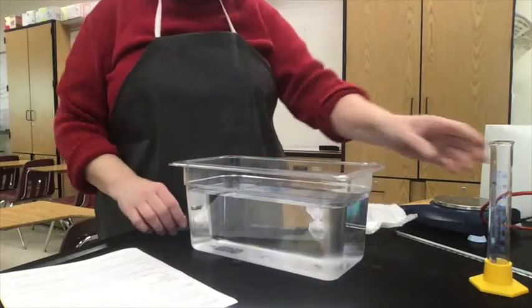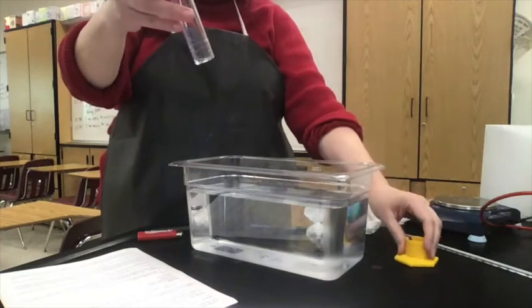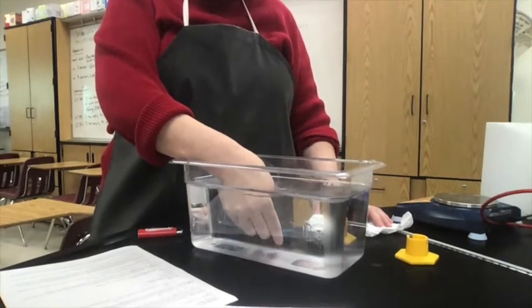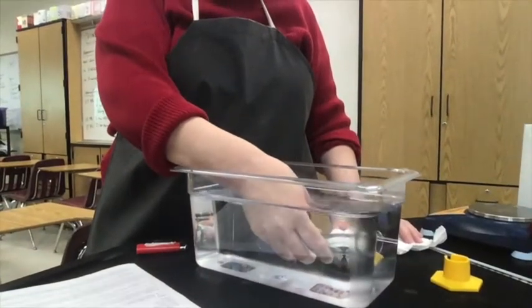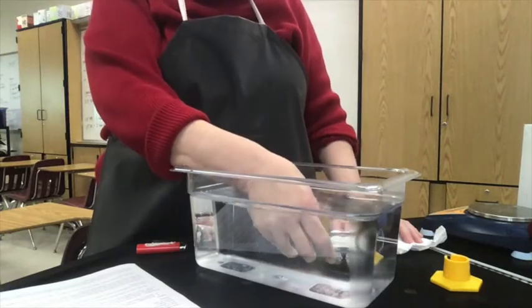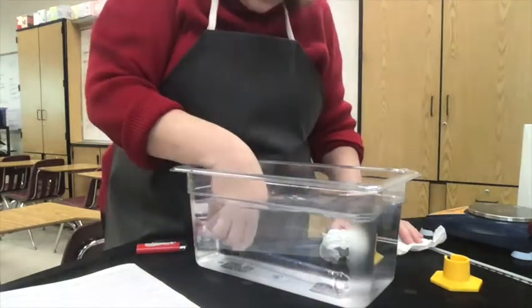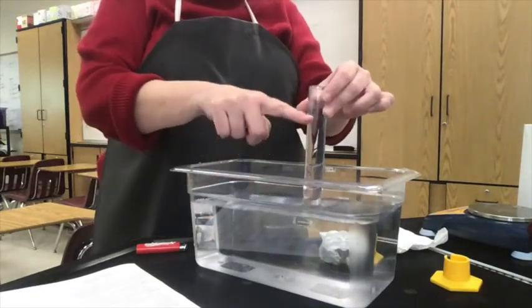Now I'm ready to do step 3, where I'm going to take this graduated cylinder. I'm going to take the bottom off of it just to make it easier to read, and I'm going to dunk it in. Remember when you were a little kid in your bathtub playing, and you would fill up your containers with water. What I'm banging it for is trying to get rid of the air bubbles there. It says be sure there are no air bubbles. I'm kind of failing, so I'm going to redo it there. And once we fill it with water, we invert it like this, and we have a filled tube with water.